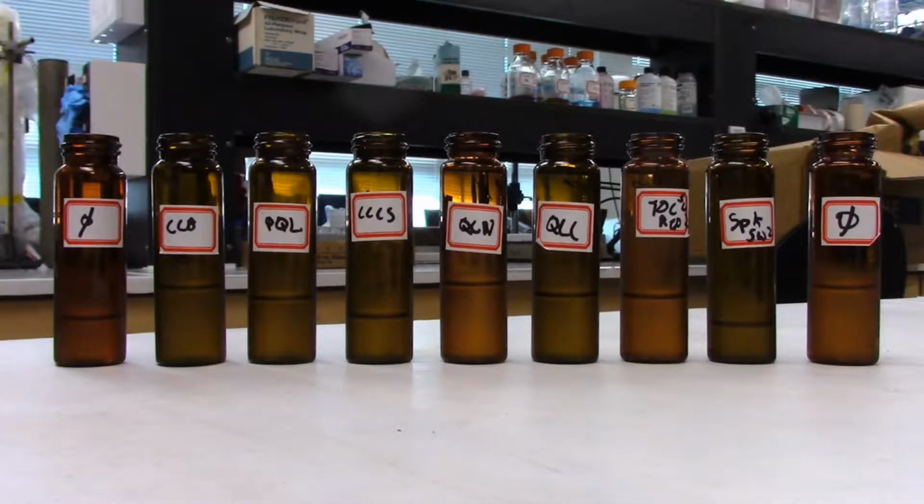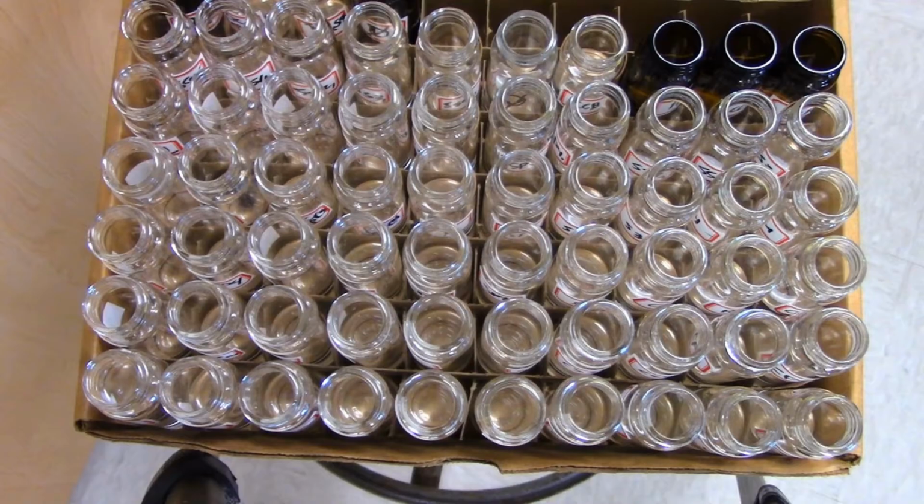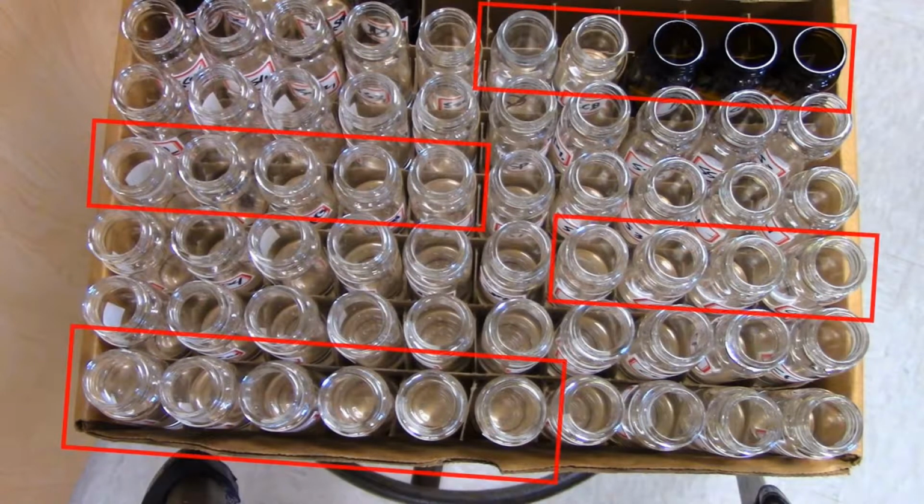Also required for the TOC TN are rinses before and after the QA/QCs. Many of these controls must be conducted every 20 samples and at the beginning of the analysis. Keep this in mind as you only have approximately 60 spaces on the instrument.